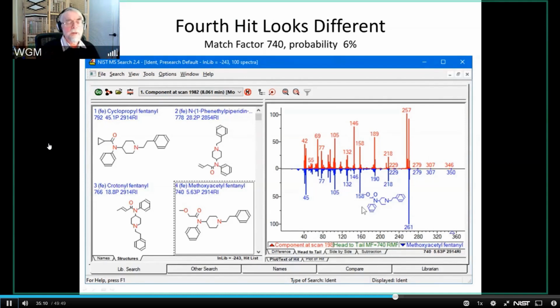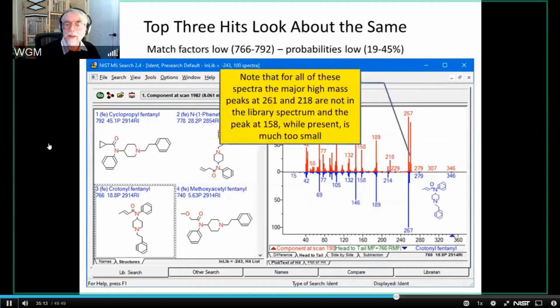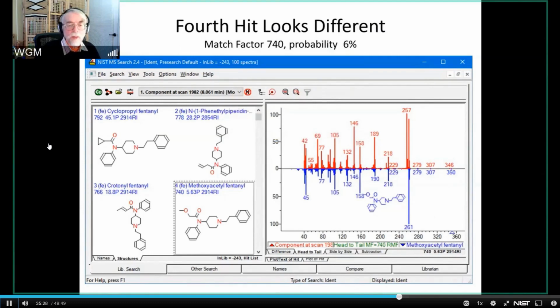So this almost immediately would imply, if you go back to these things, that you've got a mixture here. You've got a mixture of the thing that has the 257, or maybe more than one thing, but definitely one thing that has the 257, and the thing that has the 261. So very much the way I did before in the other case, but here, if you'll remember, AMDIS did not find two components. We suspect two components because of the results from the mass spectra alone. That is to say, the mass spectra alone is telling us there's something funny going on here, that we're missing in three of these cases.